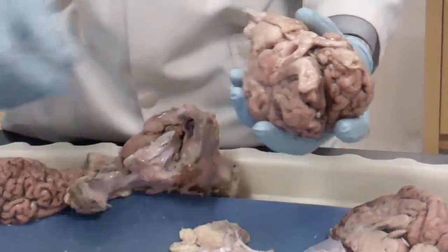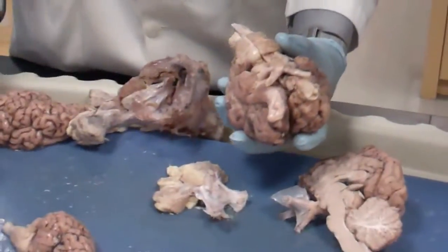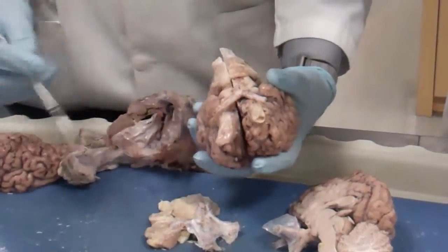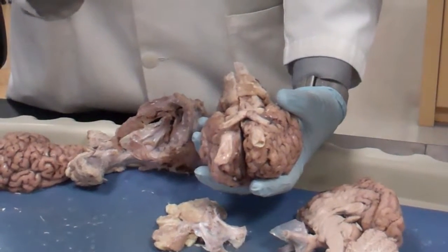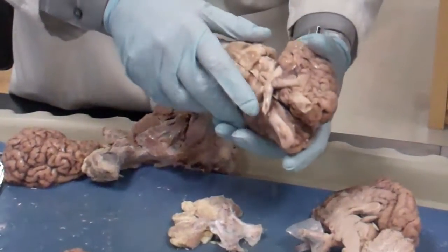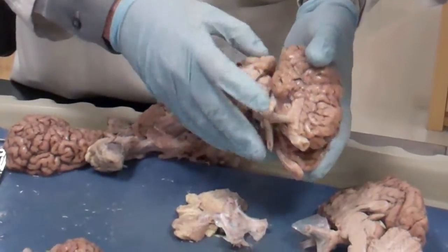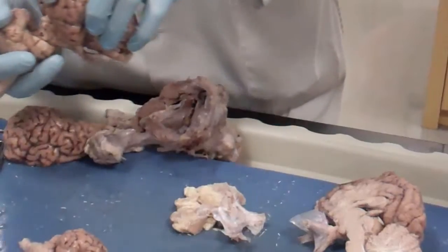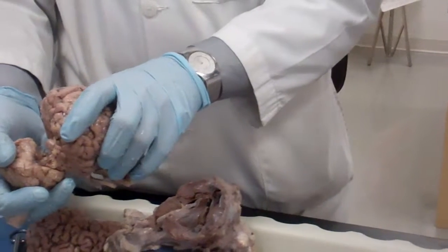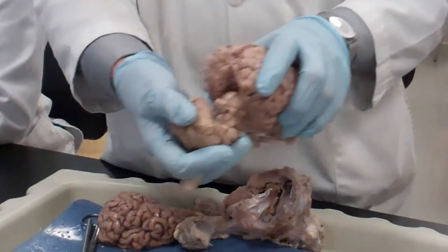From the front, from the base of the brain, you can also see the two finger-like projections. There is one and there's the other. These are the cerebral peduncles, which make up the midbrain.